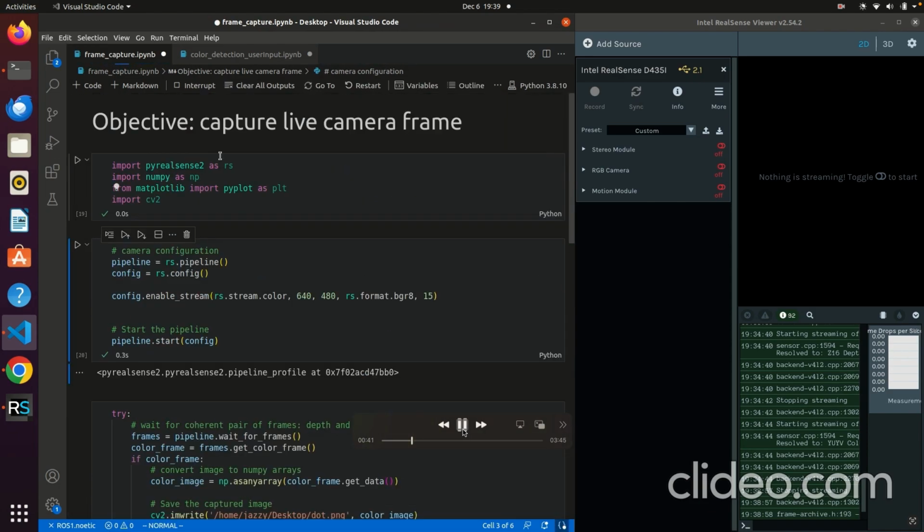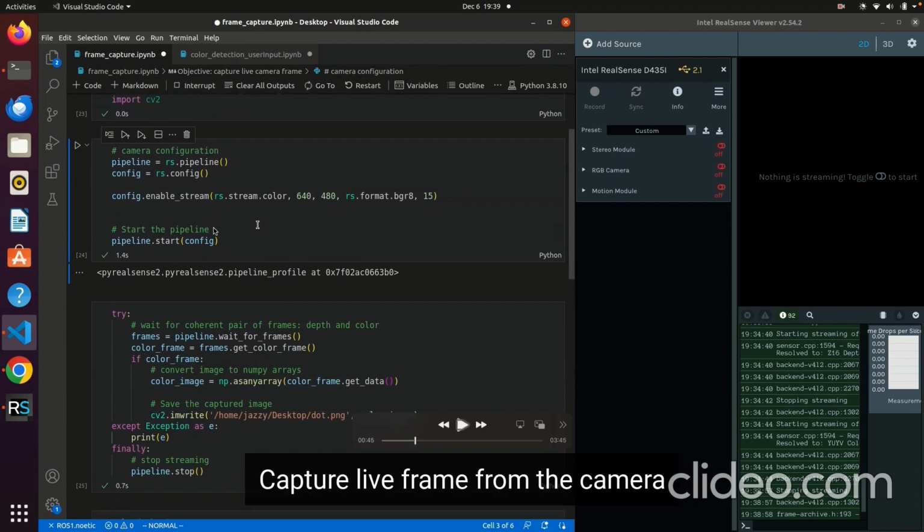So here, capture the live frame from the camera. This is where you configure the pipeline for your depth camera. Right now, the pixel size is 640 by 480, in BGR, at 15 frames per second. This line of code enables the stream, and you start the pipeline, and here you wait for the frames. In this code you will write the new image to this directory for later use.